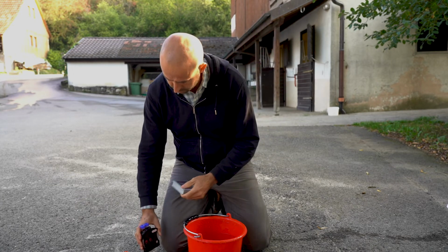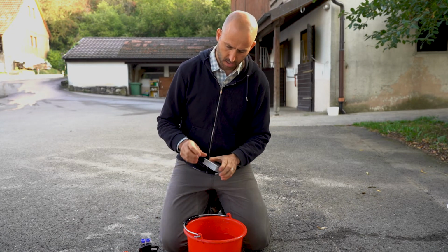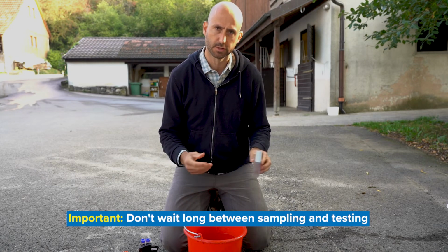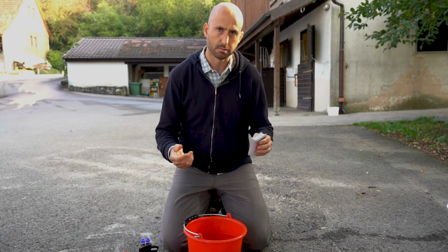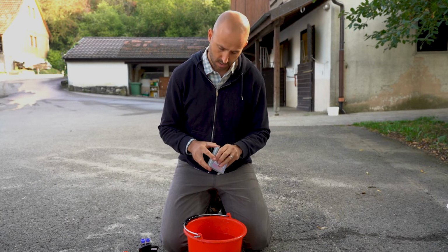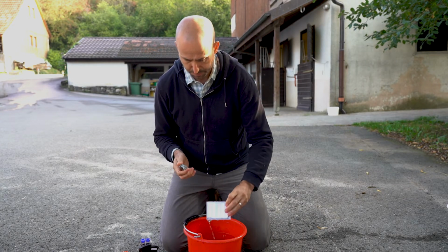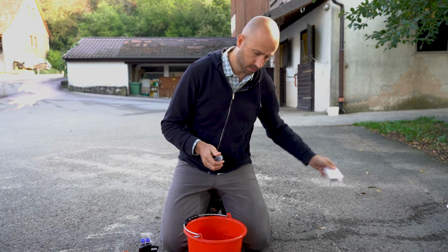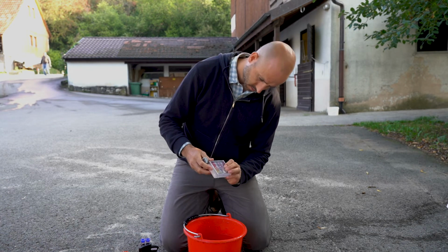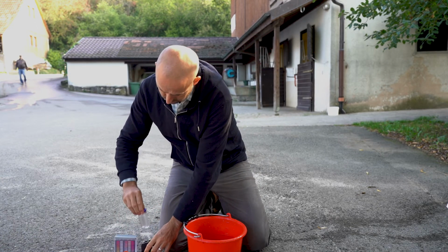So the first thing we need to do is get a sample of the water that we want to test. The important thing is to make sure that when you collect the sample, you carry out the test within a short period of time after collecting it, because chlorine does volatilize quickly. So first we fill up and rinse out our containers. So this one. Second one.